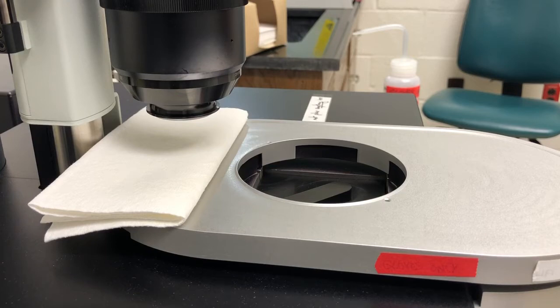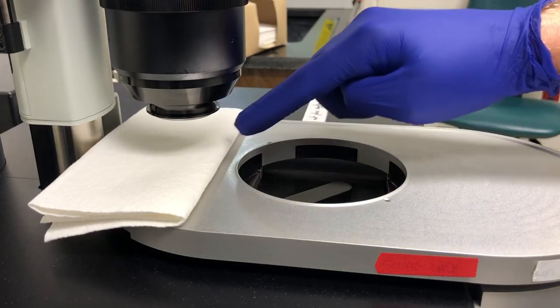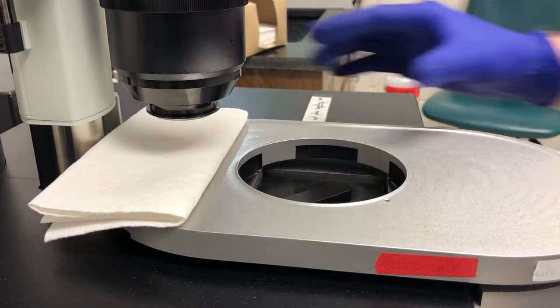This video is going to cover some of the more critical maintenance tests related to the UltraMicroscope II. So the first thing I'm going to start by showing you is how to check whether the corrected dipping cap is in good condition. To do that, we will put on gloves because that dips into the DBE. And we are going to pull this element down very gently so that we don't smash it down here, and then look inside.